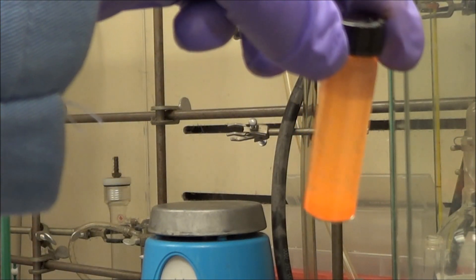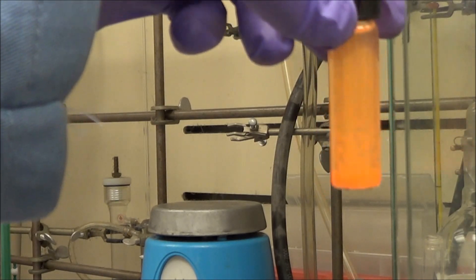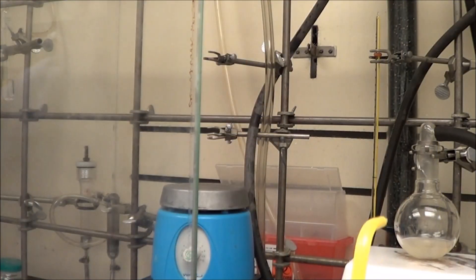That's a really nice precipitation, so the dots are precipitating quite well, but there's also a large amount of excess ligands, which later on in the process is going to cause a little bit of a problem, but of course we have a solution to that.